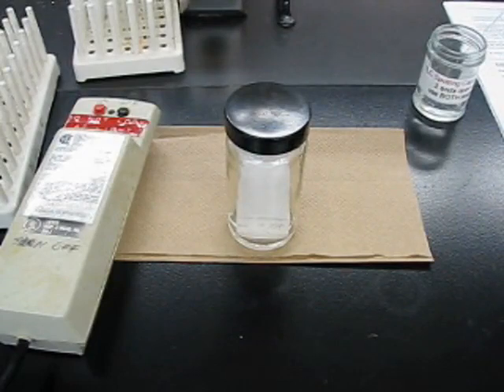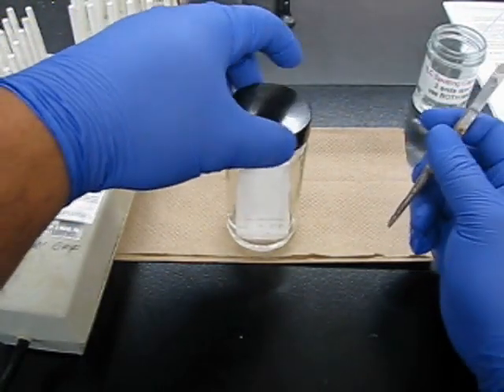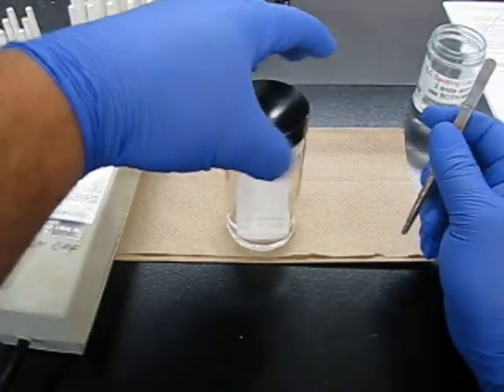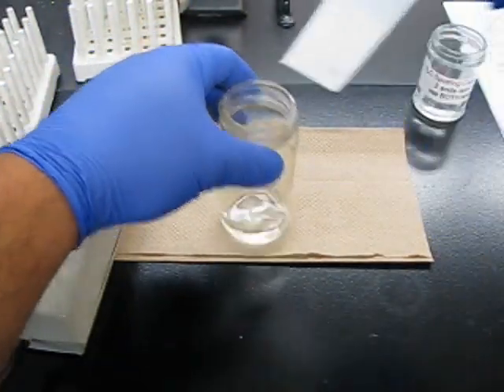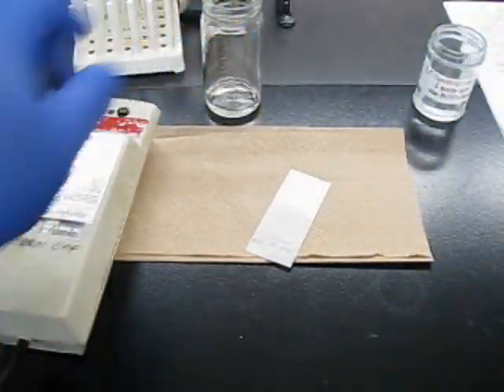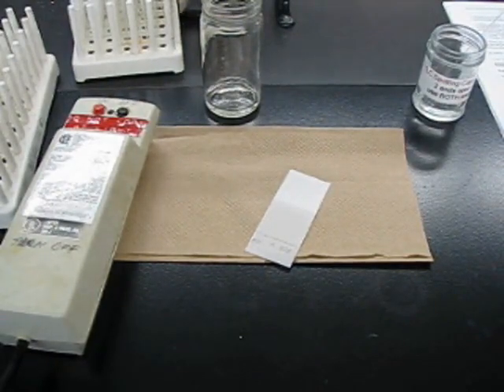Don't walk up to your TA asking if it's good or done. As the solvent rises up, it's subjective when you want to take it out, but you should at least probably go three-quarters of the way up the TLC plate. You're going to mark off the solvent front.